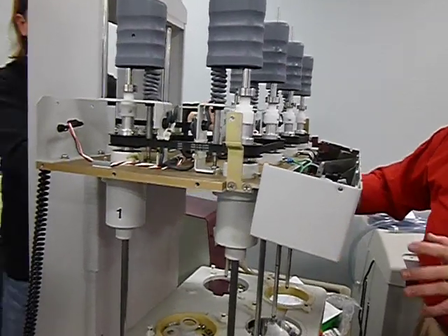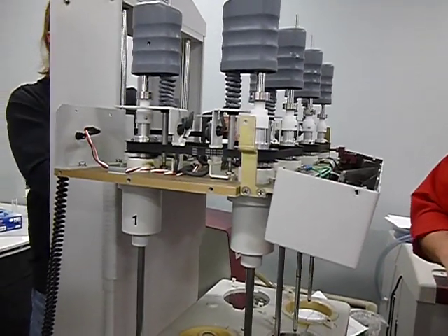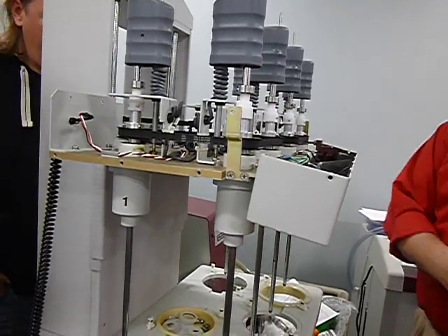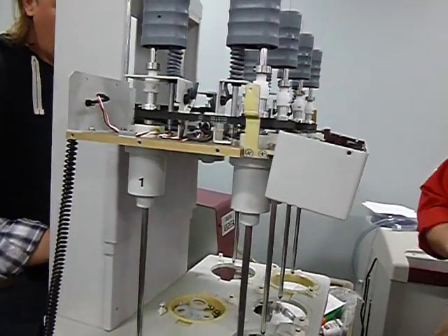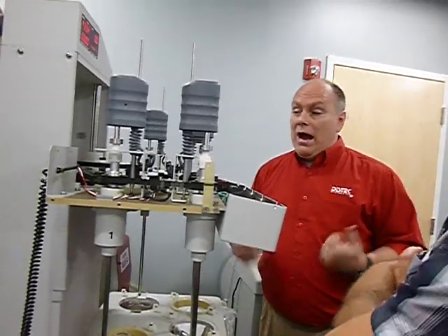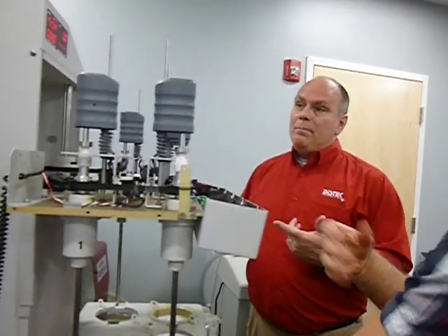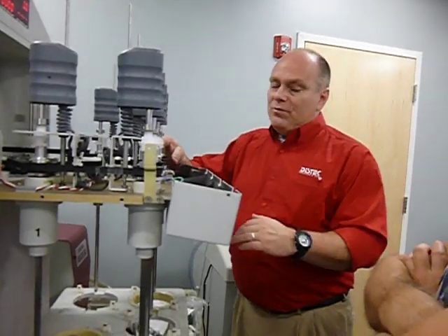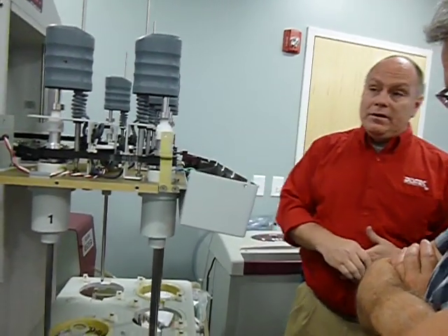I've seen it sometimes slowly go all the way down to the bottom. If I put the brake in, it's getting worn out. It's probably going to need to be replaced. Probably not. Maybe the next time. Maybe the time after that. I usually tell the customer that, hey, we need to start thinking about changing this if you want to. I personally don't want to have to change it because it's a pain to change. Me too. But if I push this in and it slams down, it's got to be replaced.